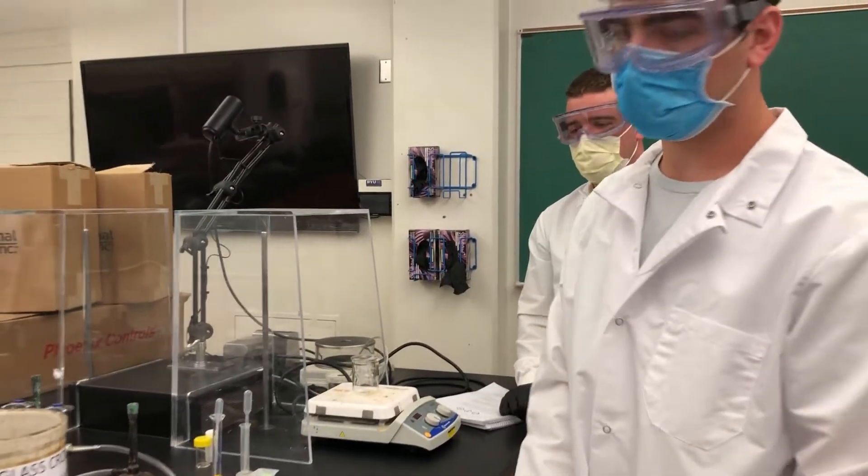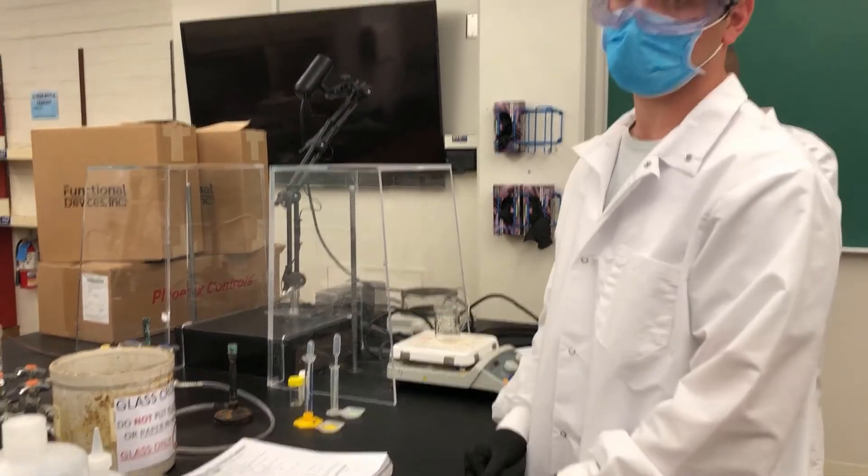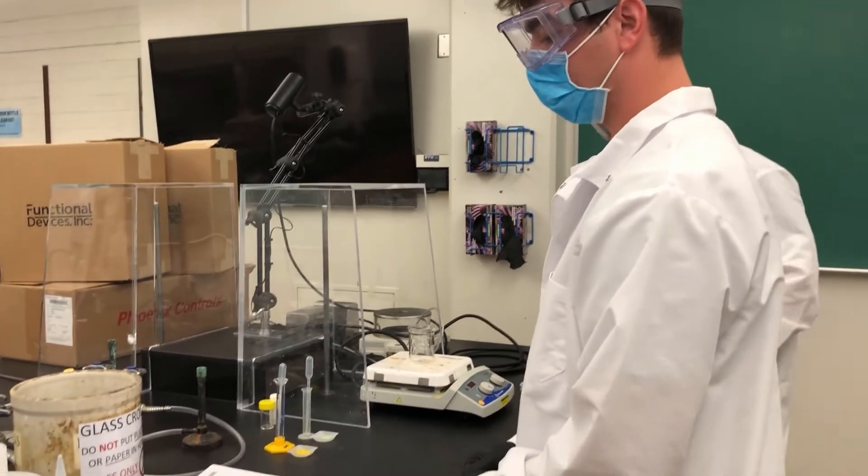Okay, to prepare the ferrofluid, first we need to make the iron 3 chloride solution and the iron 2 chloride solution.